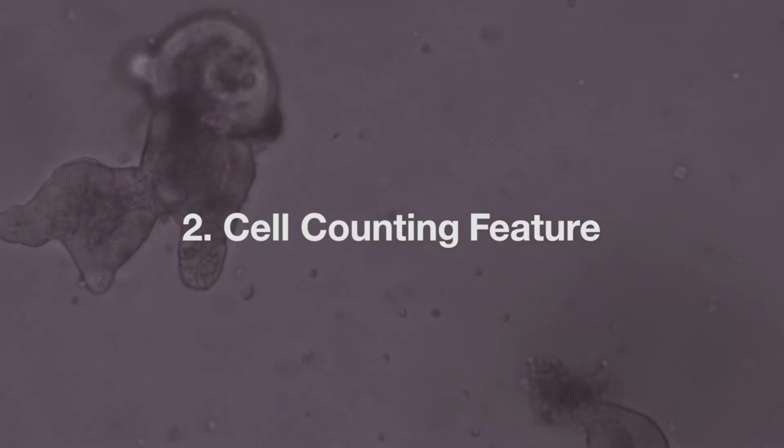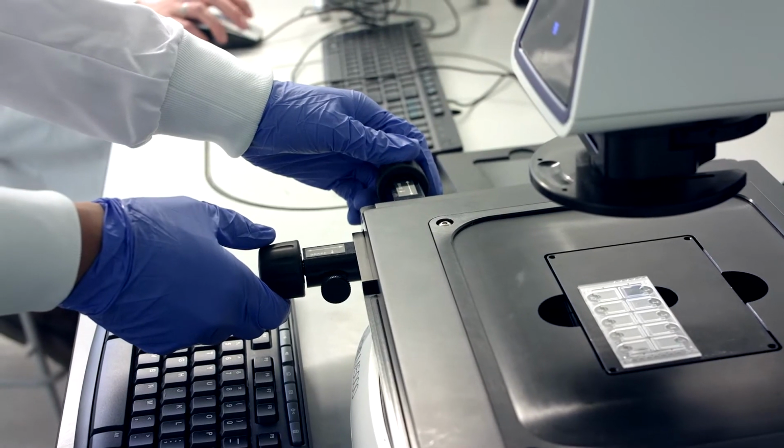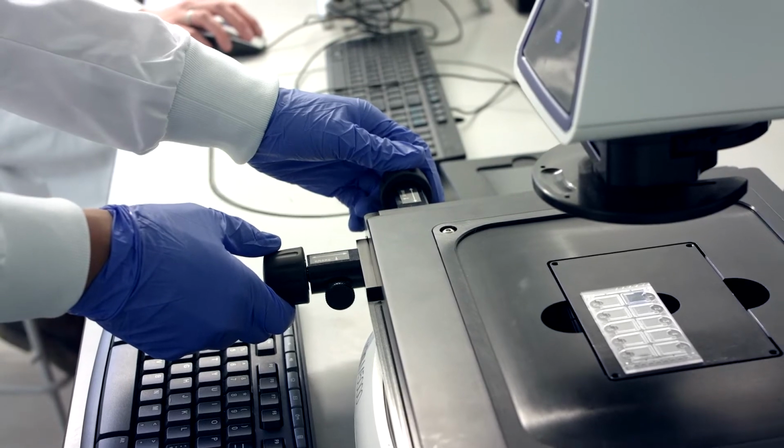Previously we did not have the cell counting feature, and that itself is a massive improvement, especially when you're working with monolayers and you've got multicultures. If you've got different cell types in the same well, it's easier with the cell counting feature, where you can differentiate based on circularity or density of staining to tell apart your different cell lines within the same culture.